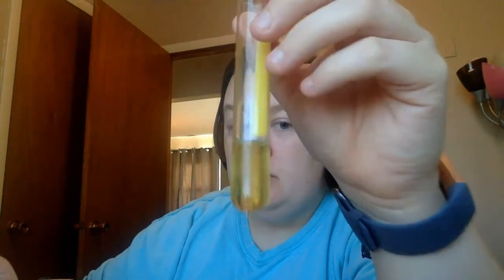So by size, we were able to separate our waste product into 3: blue, brown, and yellow. Blue came out first, so we knew it was the largest. The yellow came out last, so it was the smallest. But one thing about gel filtration is that if 2 molecules are very close in size, they can't properly be separated. So while we were able to filter this into 3 components, there could be multiple components mixed together in any of the samples.